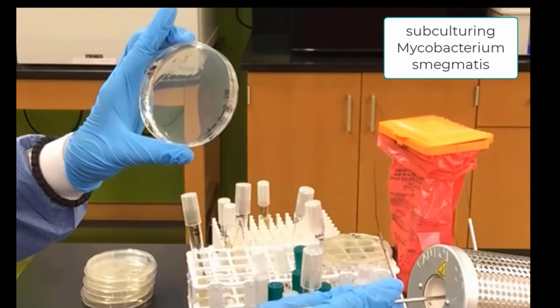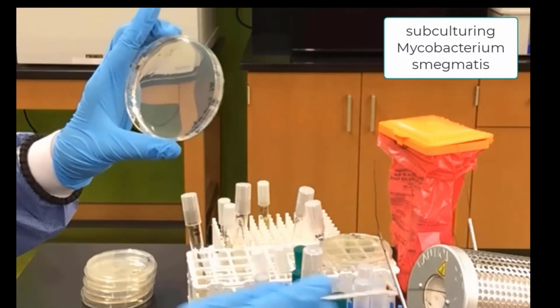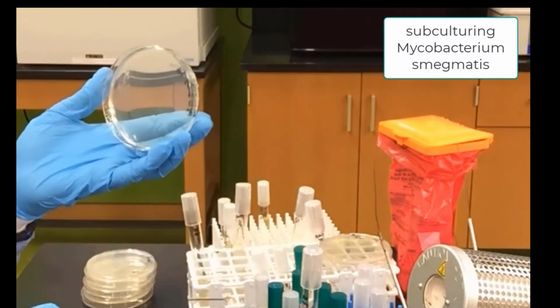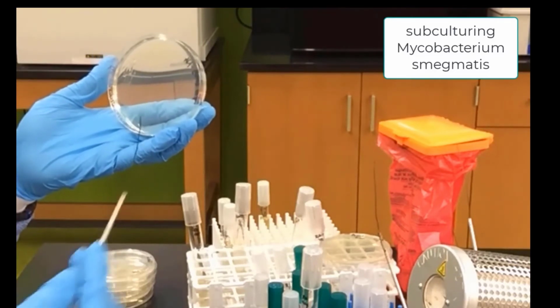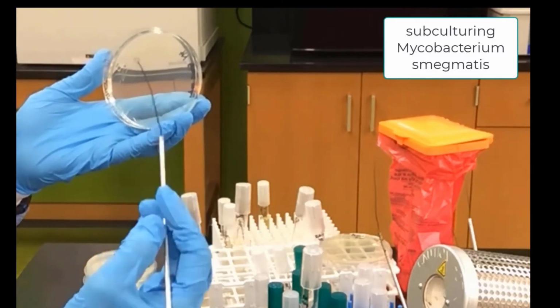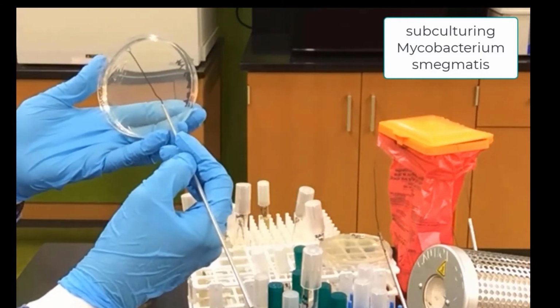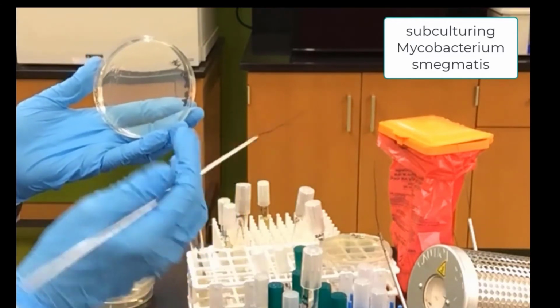We sterilize our loop. We turn our plate 90 degrees, and with a cool loop, without picking up any more Mycobacterium, we drag the first streak over into the empty space, making a second streak.